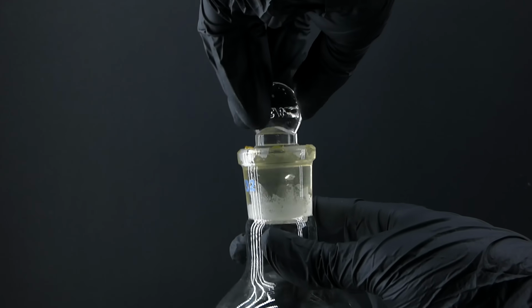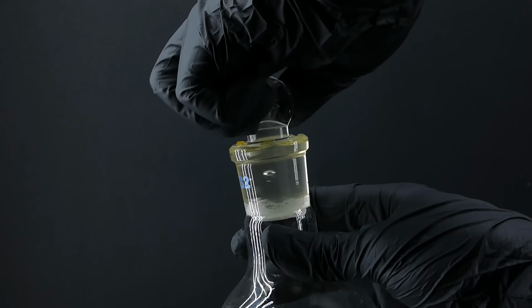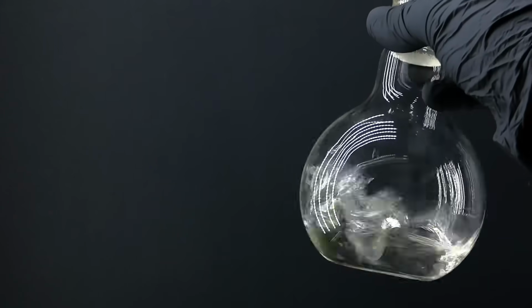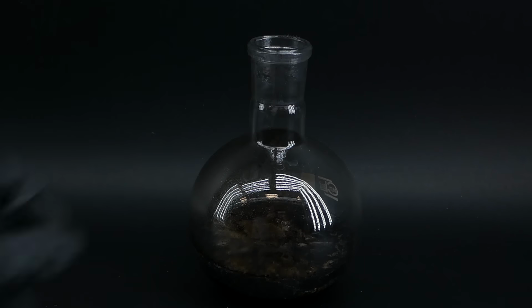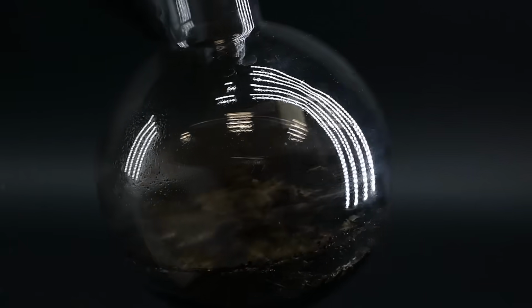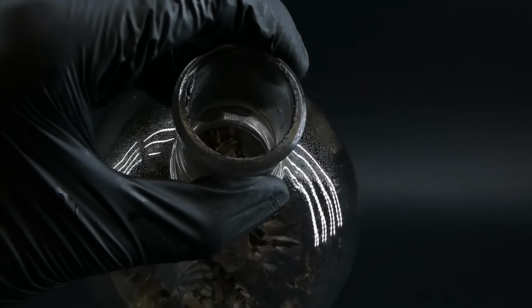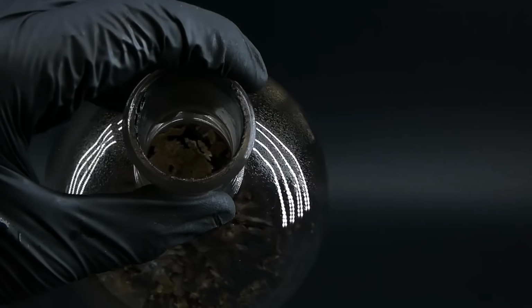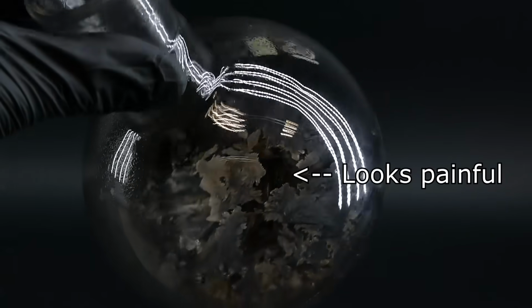Since it is a volatile acid, I sealed the flask with a glass stopper and some grease to prevent anything from escaping, and now I wanted to take a look at the boiling flask. The black liquid inside had solidified into a solid crystal brick composed mainly of sodium sulfate and unreacted sulfuric acid. It had some really nice crystals inside, but just from the looks of it, I know that this is going to be a pain to clean.